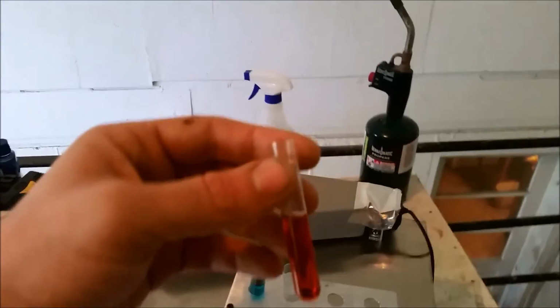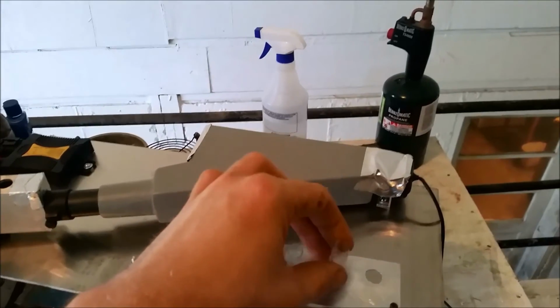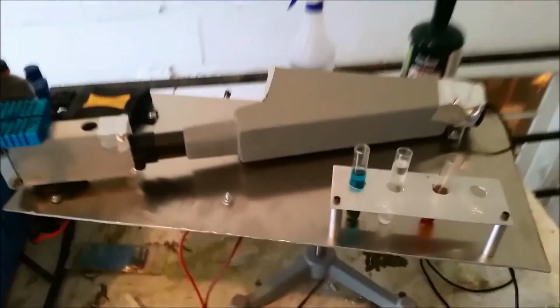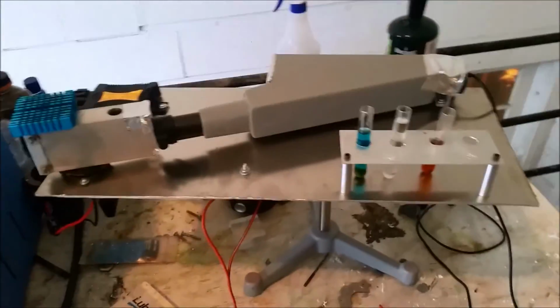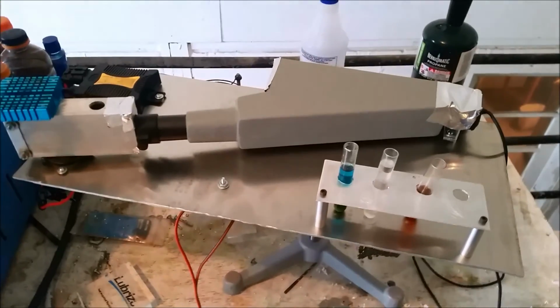But the spectra reading doesn't really matter anyway, because the spectral lines from the mercury in the bulb overpower everything else, and I can't get a good reading on anything beyond that. But either way, I'll go ahead and get it hooked up and fire it up and show you guys what it's like.